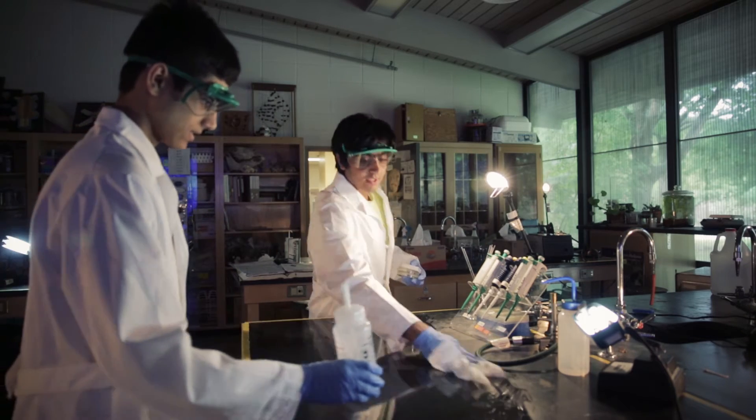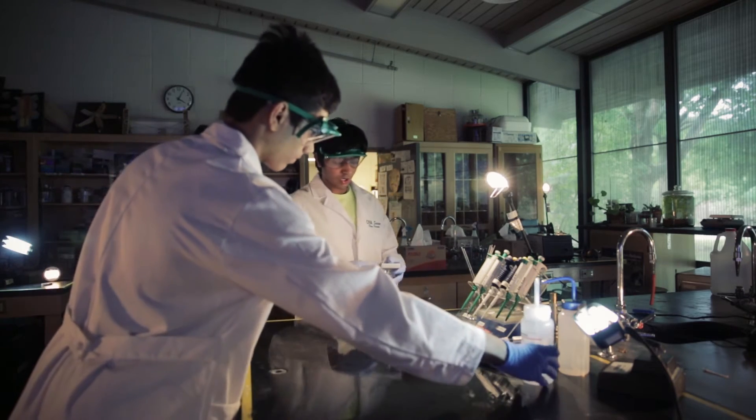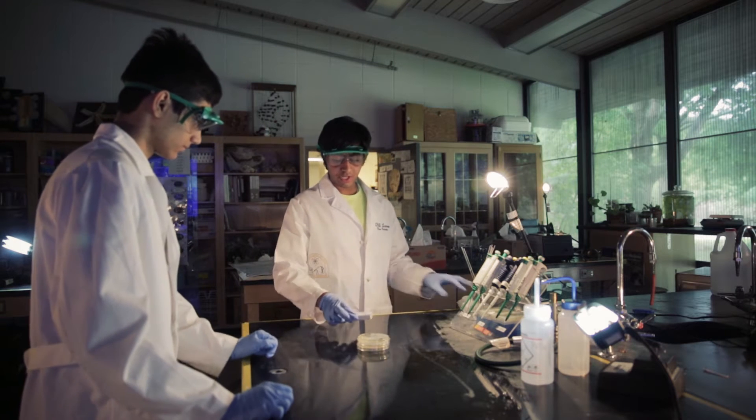Okay, now that we've sterilized the table, we can put our plates and our actual bacteria down here.